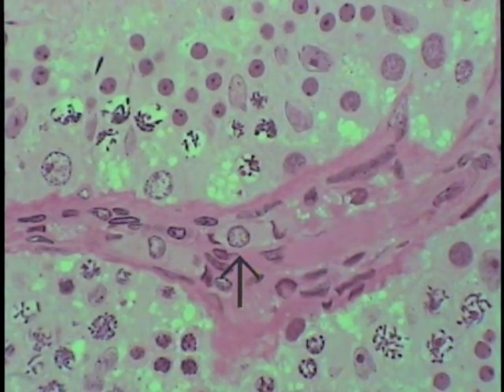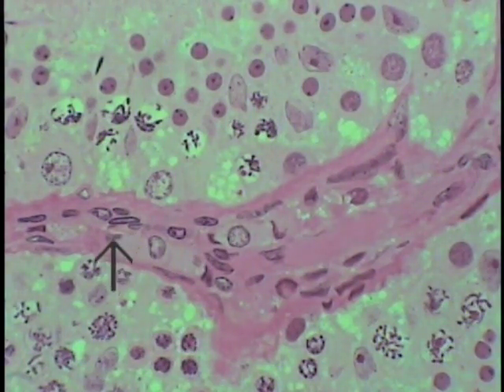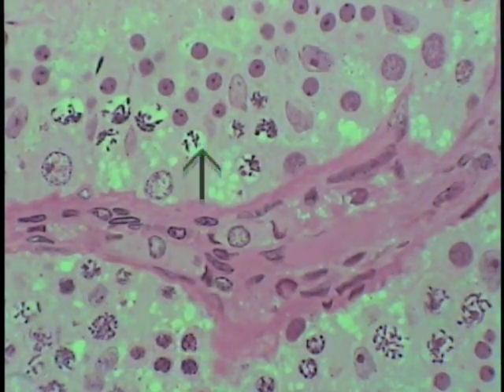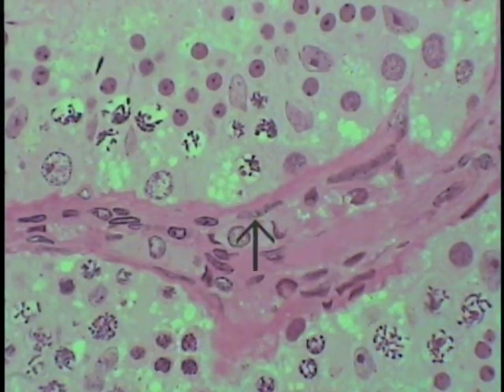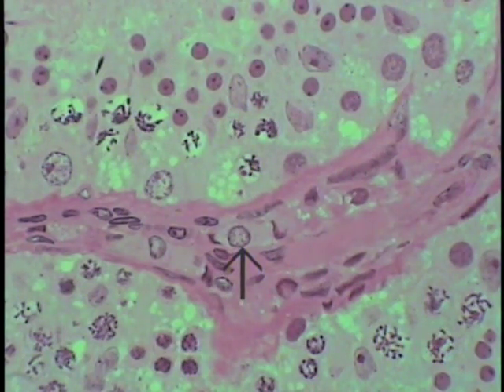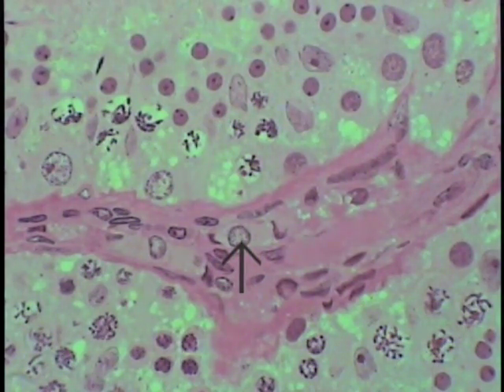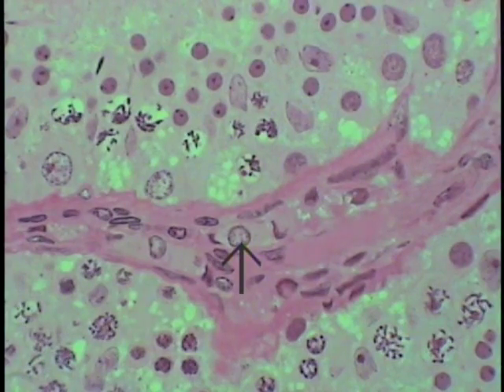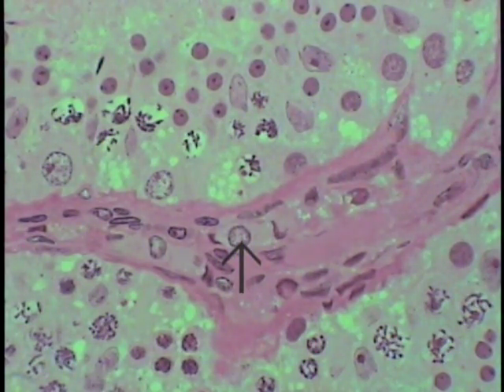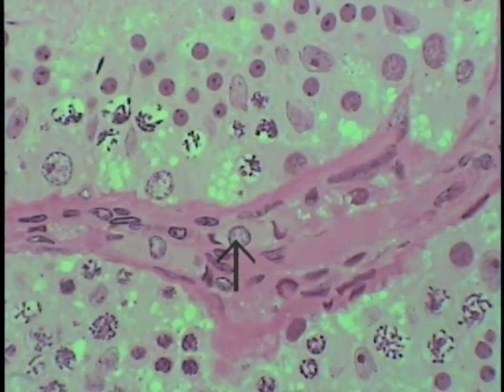Two adjacent Leydig cells are indicated by the pointer in the interstitial tissue between seminiferous tubules, seen at high magnification. Recall that these cells are the target of interstitial cell stimulating hormone (LH or equivalent terms) and that the primary secretory product of this cell type is testosterone.